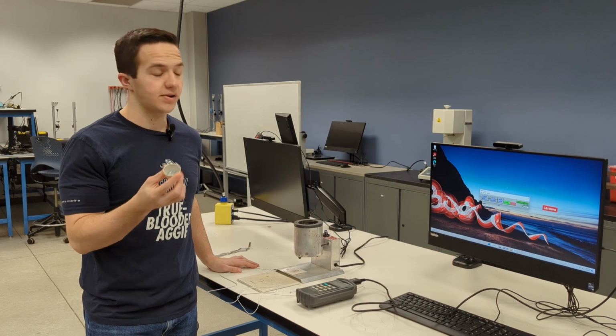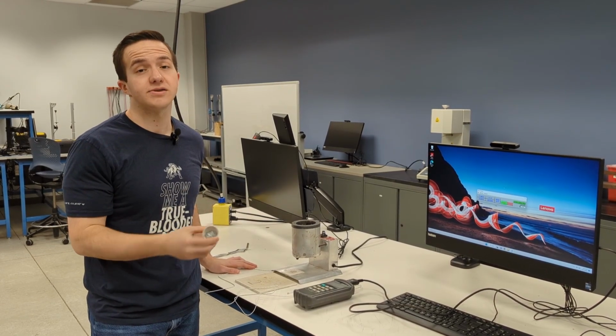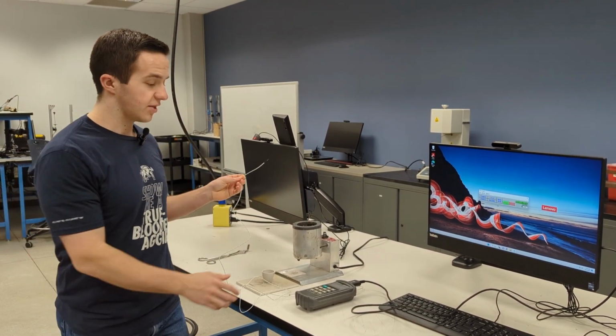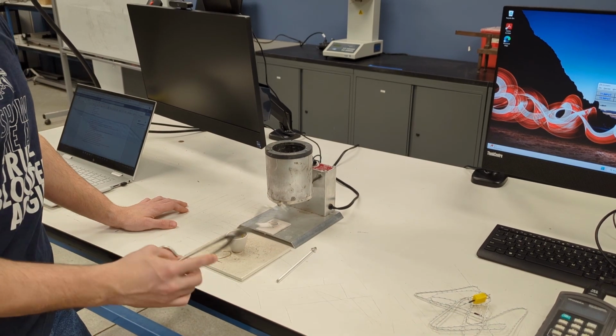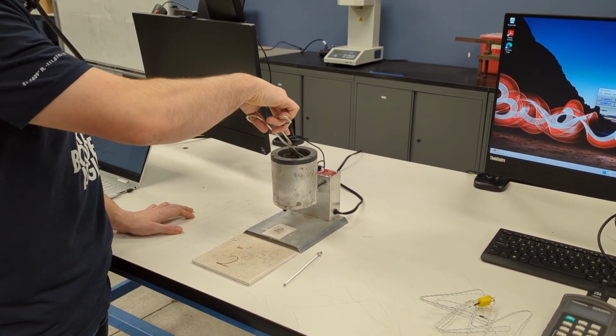And so what you're going to do is take the crucible and place it within the heater. Make sure it's turned on to high so that the mixture completely liquefies. And after the mixture is liquefied, what you will do is place a thermocouple within the mixture and use a thermocouple reader to read the temperature. To begin the lab, you will insert the sample into the heater using the tongs.